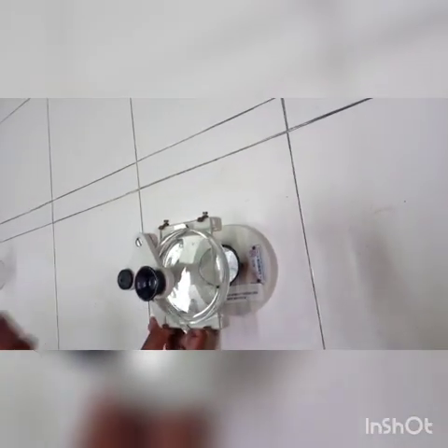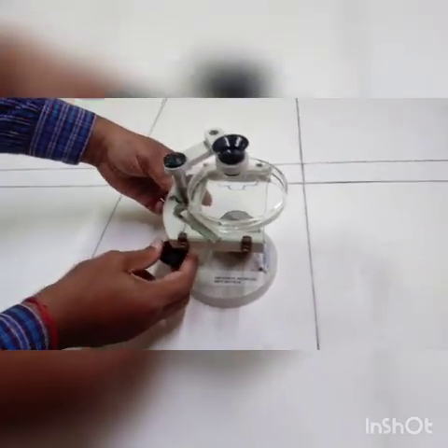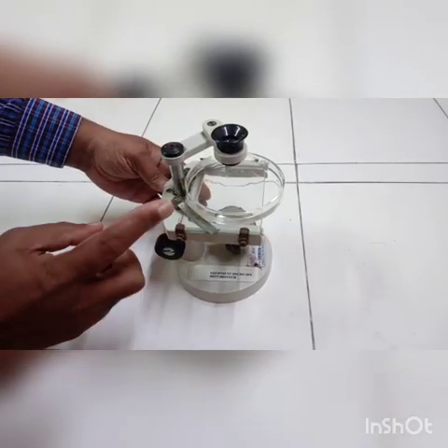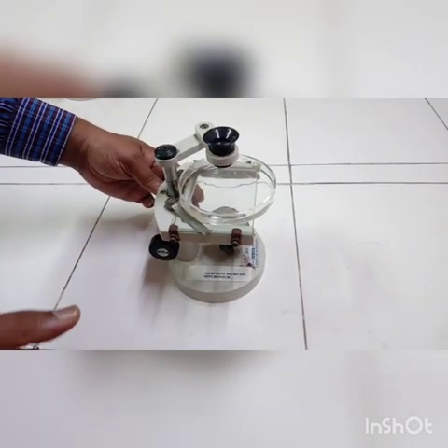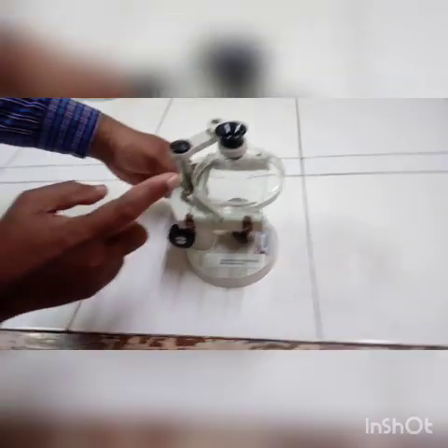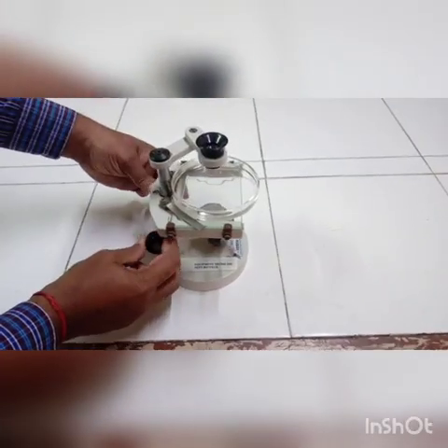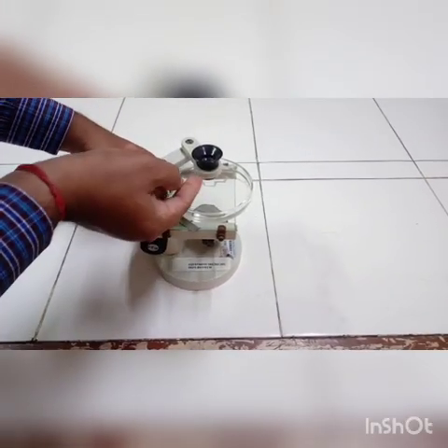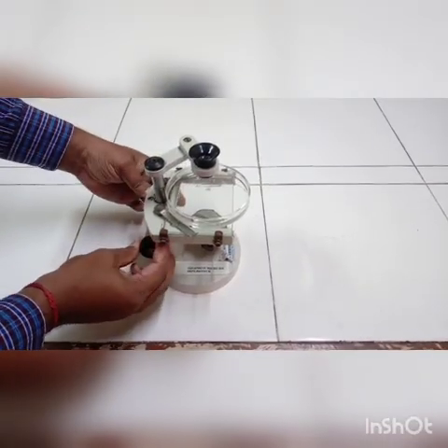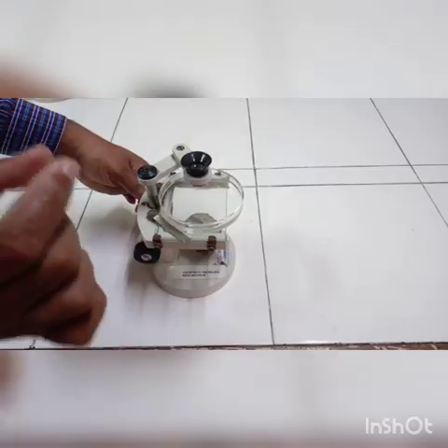Another important difference in the dissection microscope is that we have only one adjustment, called coarse adjustment, whereas in the normal laboratory microscope we have coarse as well as fine adjustment. By doing the adjustment, you can see that the lens goes up and down. So this is almost equal to adjusting the image to make a clear vision.